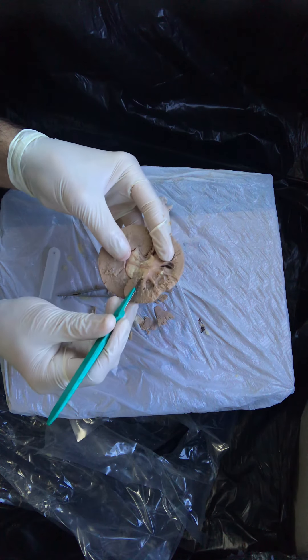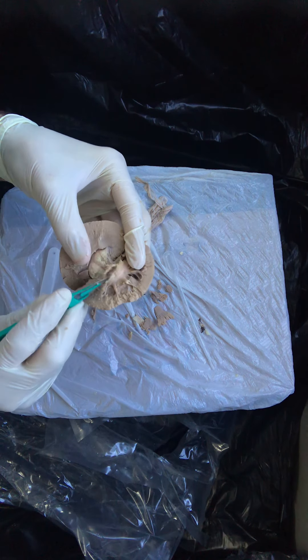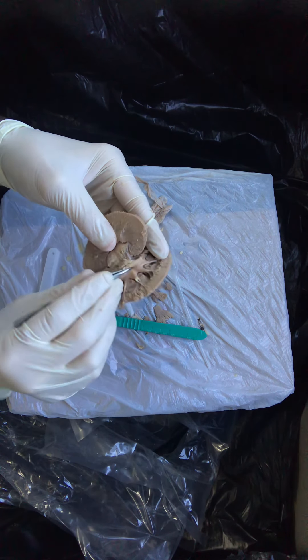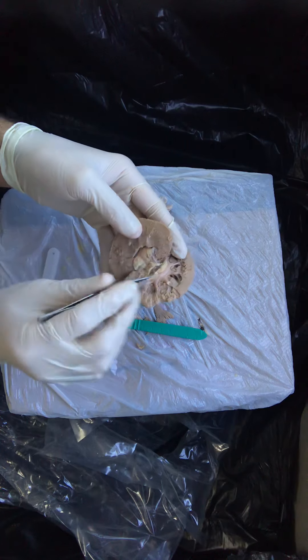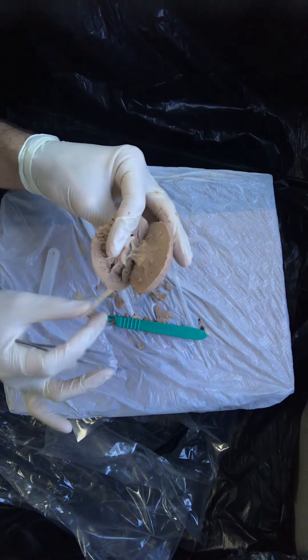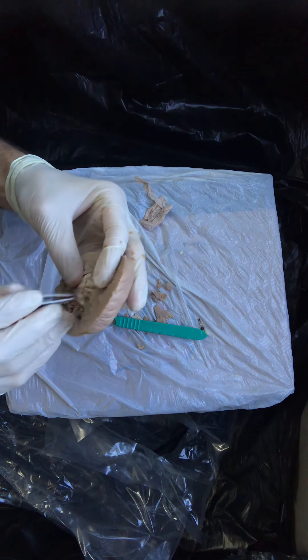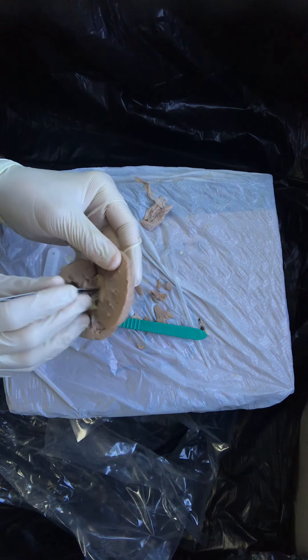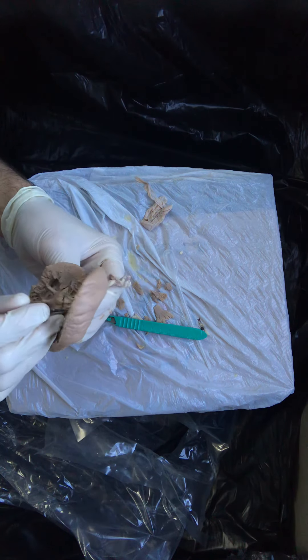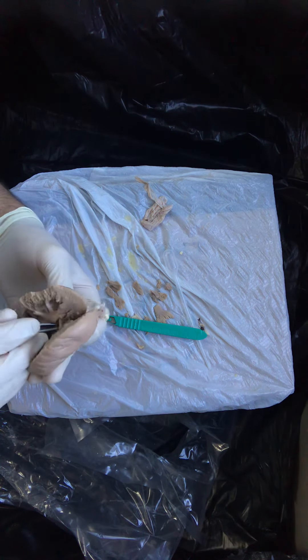If we open this up — and it's a little bit hard on the sheep's kidney, just because of its small size and its preservation — but if you incise or make an incision into that large renal pelvis, then you would be looking into that hollow structure which ultimately collects all the urine produced by this kidney and drains out of the ureter. Frankly, it's pretty difficult the way these are preserved to find the entrance of the ureter to the renal pelvis. So I wouldn't get too frustrated if you can't find that.